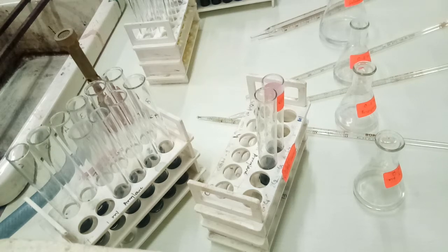So here we can conclude from this practical that as we increase the enzyme concentration, there will be an increase in the rate of reaction. But when there is saturation of substrate molecules, and no more substrate molecule is available to bind with the enzyme molecule, the reaction will not increase and we will not have any increase in the rate of reaction.